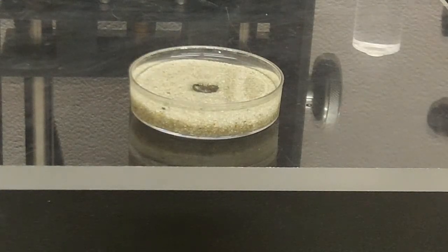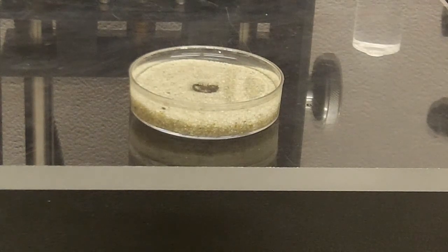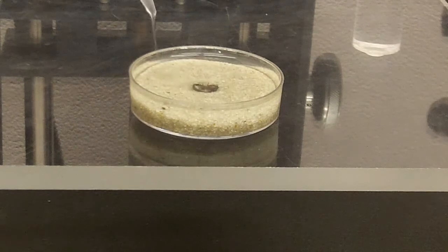And now you have the specimen ready to image. Since ethanol evaporates so quickly, you may need to touch it up a bit more while imaging.